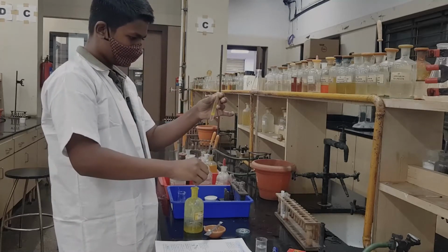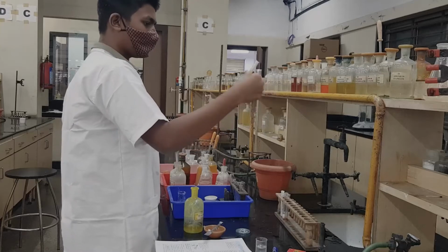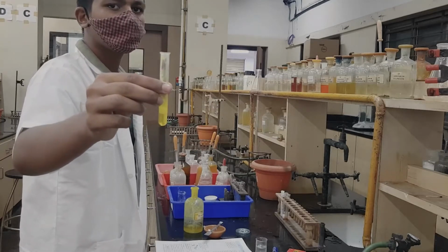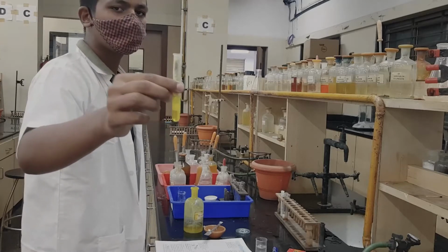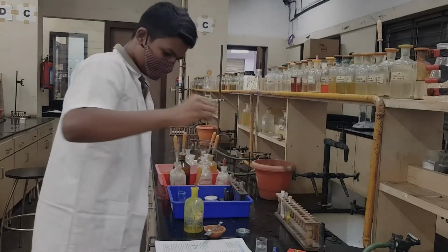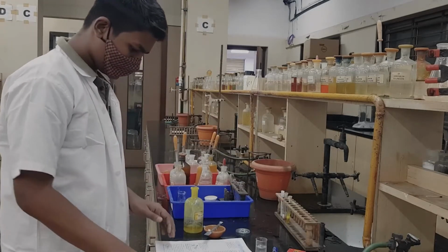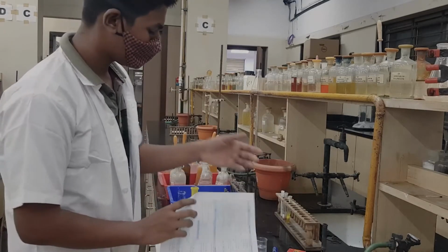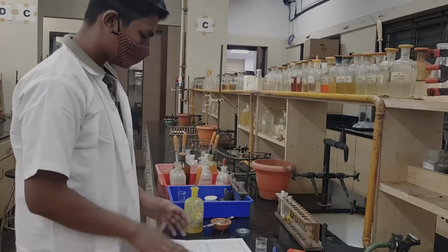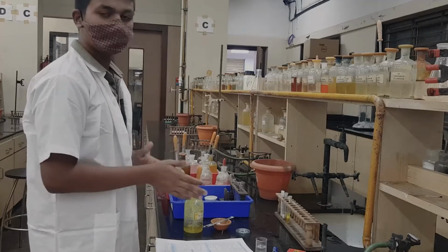To that you add picric acid in benzene. You have to just shake the solution, just jerk it. You can see clearly the yellow PPT, and that shows the another CT for ammonium. So, your ammonium radical is confirmed. Out of the 2 radicals we are confirmed with 1. Now we have to focus only on the second radical.